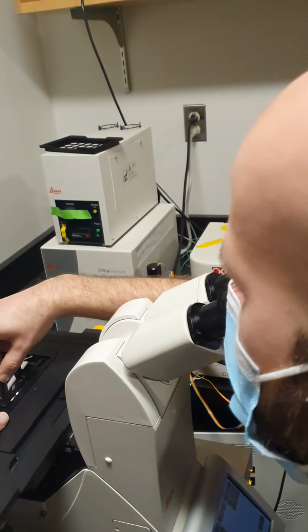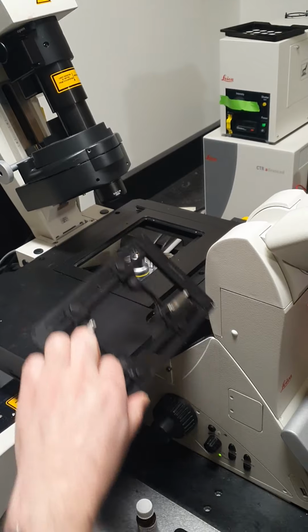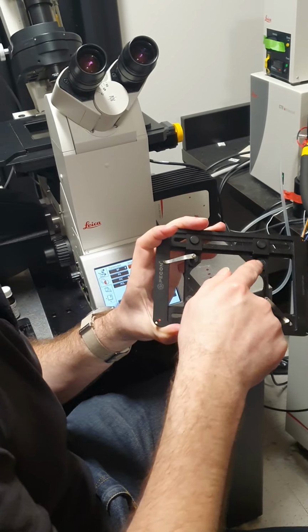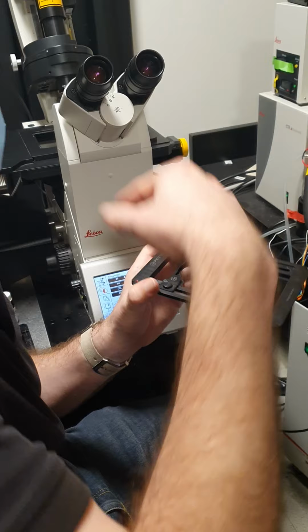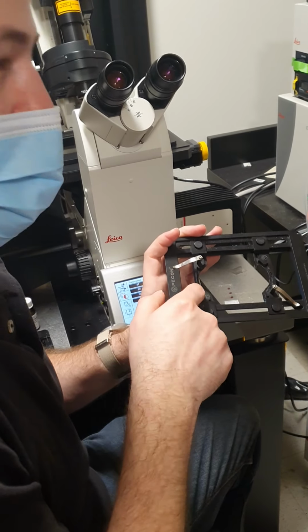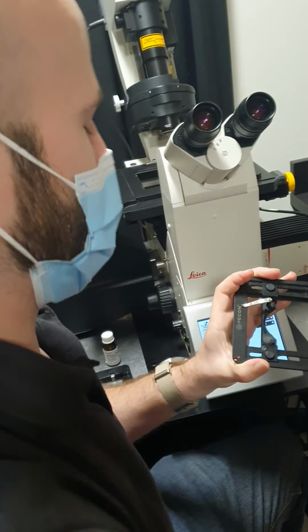And then just make sure your sample is sitting in there and feels sort of solid. One thing that can happen if you notice your sample isn't sitting very well is people often get mounting media that will build up around here. I just scraped it off earlier this morning, but that can cause bumps here, which cause your sample to sit tilted. So just check before you put your sample on. And then if there is buildup, you can just take a razor blade and scrape it off.